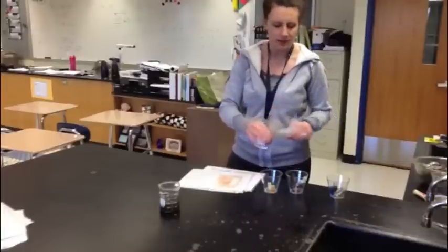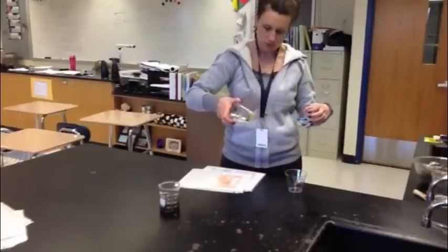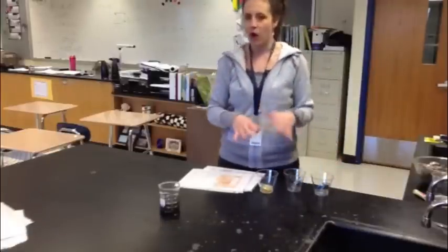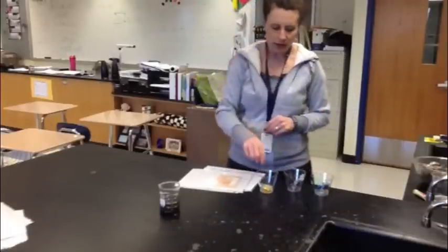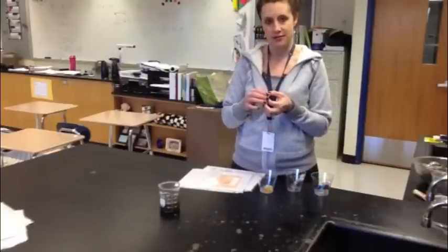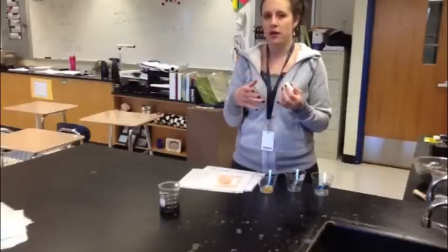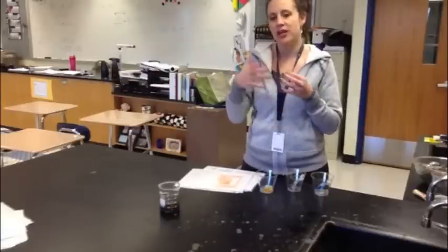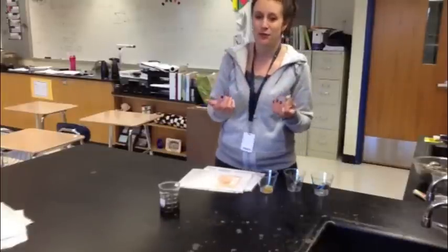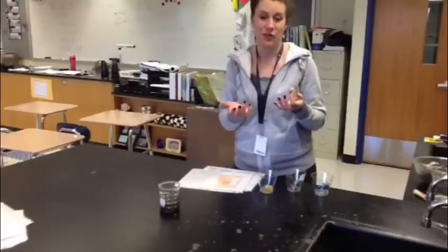For this one, there are three little cups sitting at the station: Soil Sample A, Soil Sample B, and Soil Sample C. The tests have already been done on these soils and what you're looking for is the color that has occurred in each one of the tests. They've taken a small amount of soil and mixed it with an indicator that will actually change color to show you the presence of something — kind of similar to what we did with the BTB lab where we blew into it and it was blue and then turned yellow because it was an indicator of carbon dioxide.